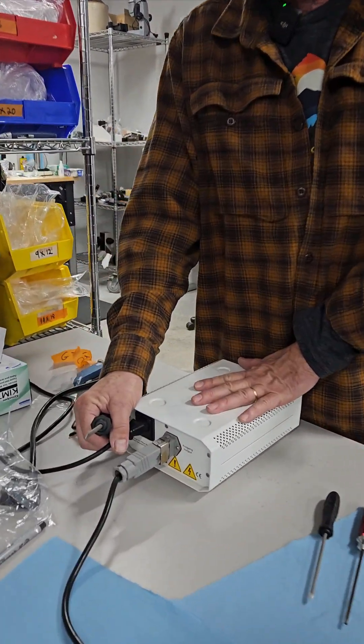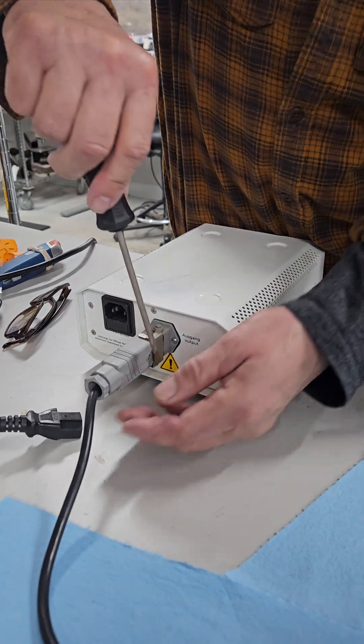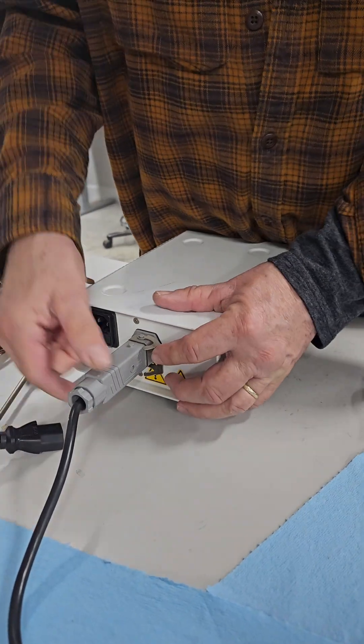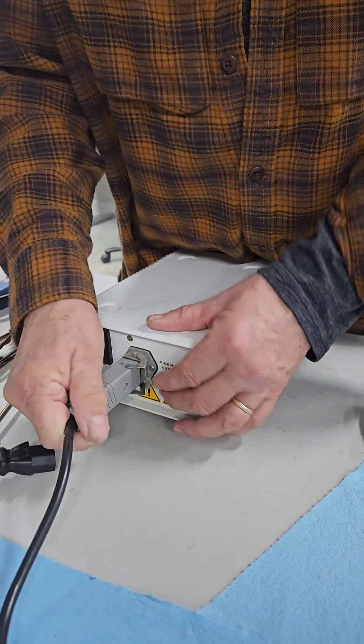Make sure your mercury power supply is unplugged. This is the socket connection. Comes off just like that. Plugs back in. Click this on.